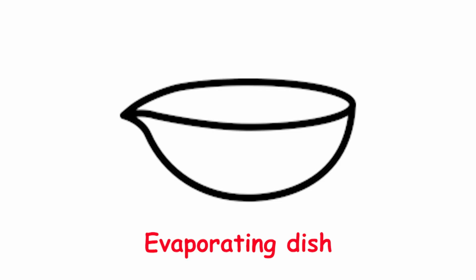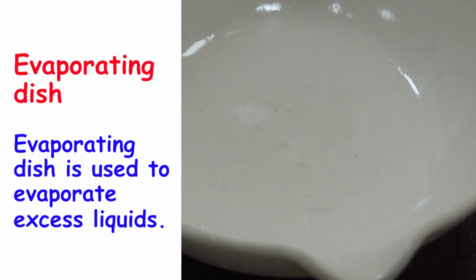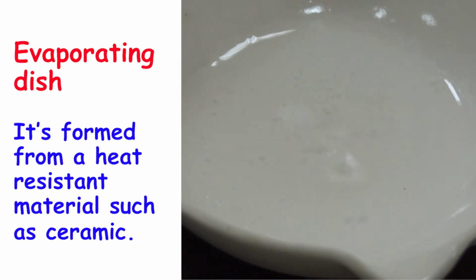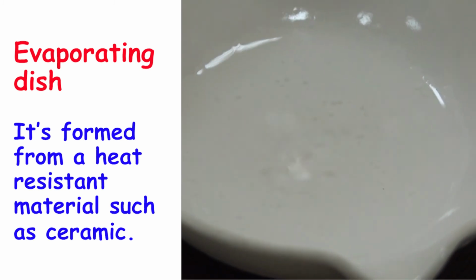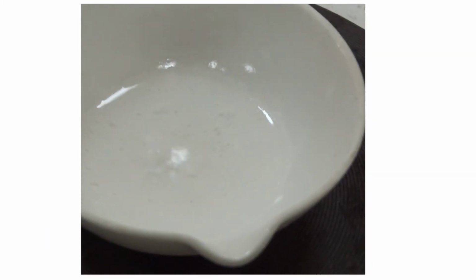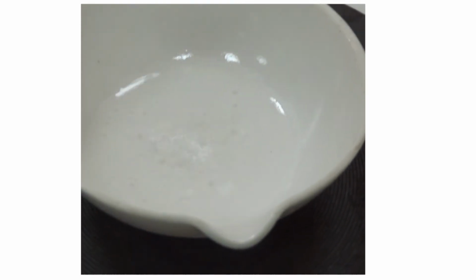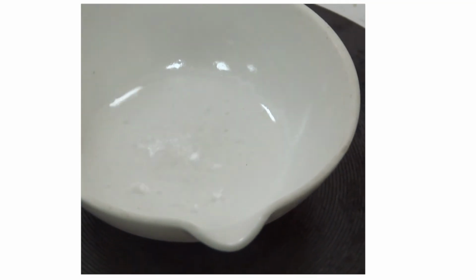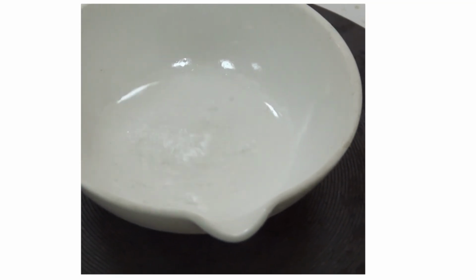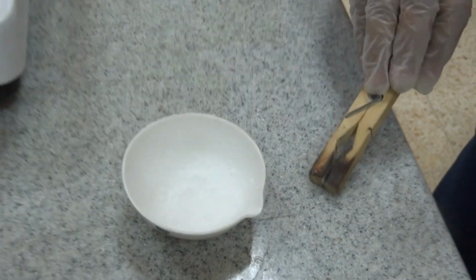Evaporating dish. An evaporating dish is used to evaporate excess liquids. It's formed from a heat resistant material such as ceramic. Look how water evaporates in order to recuperate salt alone. Hot materials such as an evaporating dish can't be held by hand to avoid burning. Look how the scientist is removing the evaporating dish by using tongs formed from wood.